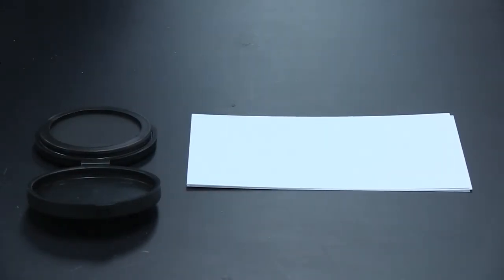This week, during the skin lab, you'll also be doing fingerprinting, and we wanted to show you the best technique to get a good fingerprint.